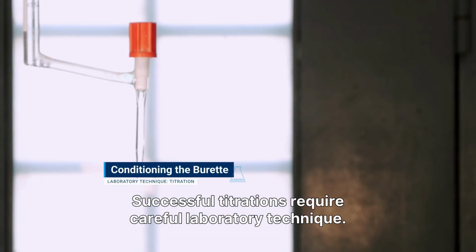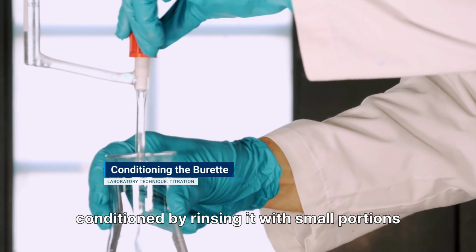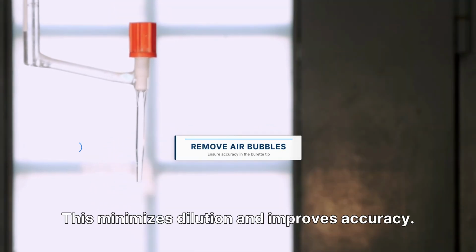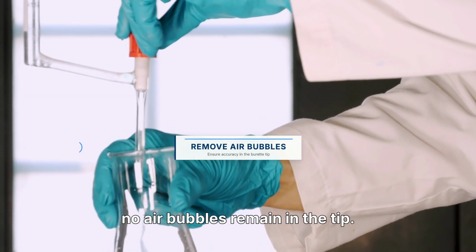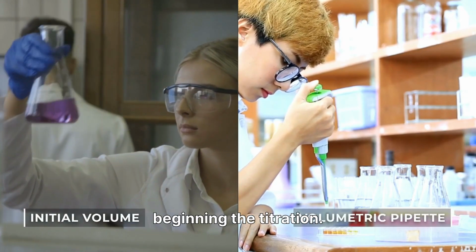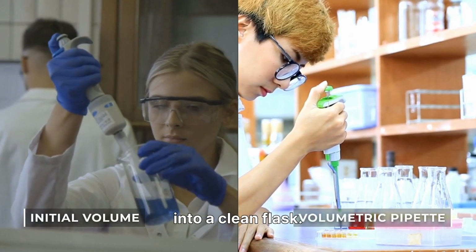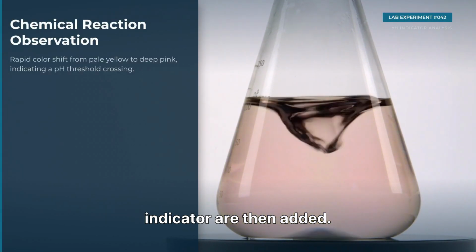Successful titrations require careful laboratory technique. Before filling the burette, it should be conditioned by rinsing it with small portions of the sodium hydroxide solution. This minimizes dilution and improves accuracy. The burette is then filled, ensuring that no air bubbles remain in the tip. The initial burette reading is recorded before beginning the titration. A measured volume of the hydrochloric acid solution is transferred using a volumetric pipette into a clean flask. A few drops of an appropriate acid-base indicator are then added.